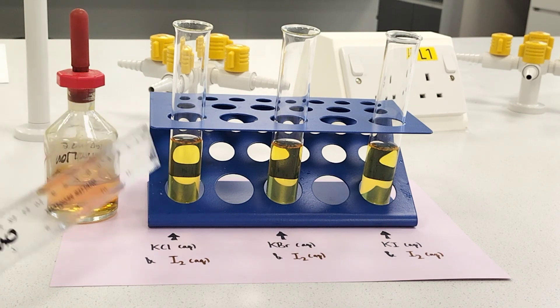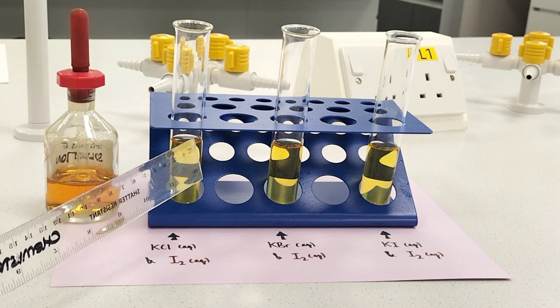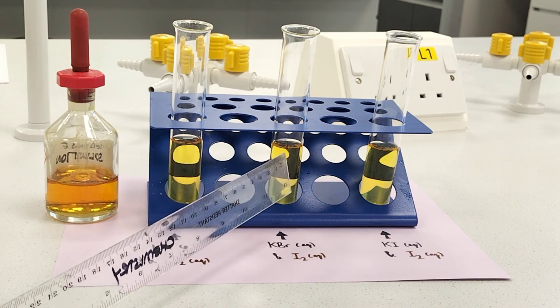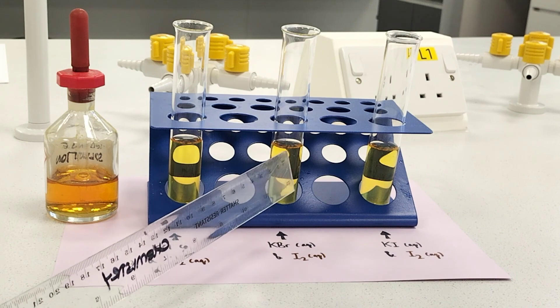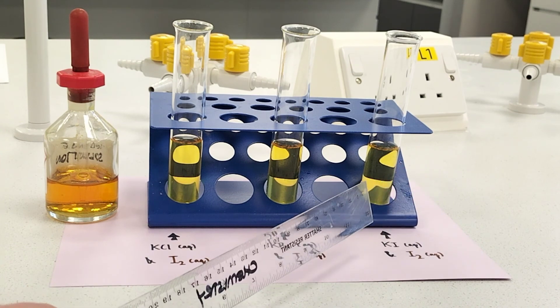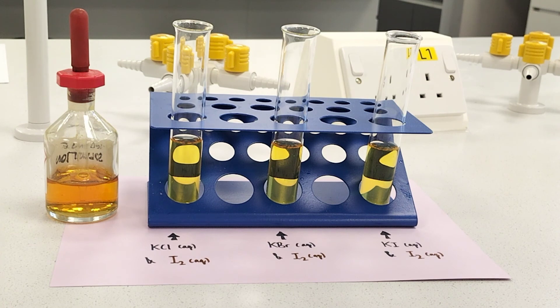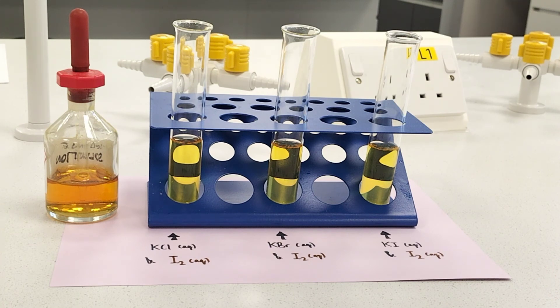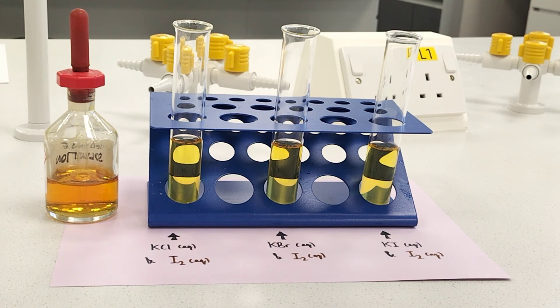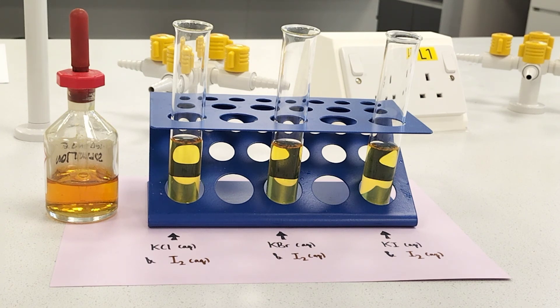Adding iodine water to potassium chloride shows no vibrant colour change — nothing's happened, no reaction. Adding iodine to potassium bromide looks identical — nothing's happened, no displacement reaction. Adding it to potassium iodide gives the same result; no reaction takes place. Iodine is the least reactive of the halogens — it cannot displace chlorine from potassium chloride, bromine from potassium bromide, or iodine from potassium iodide because they are identical.